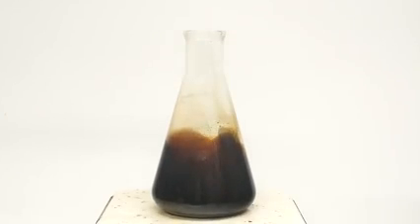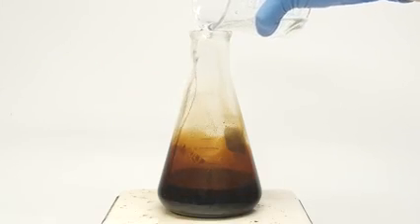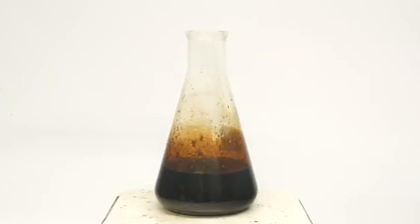To find out if I've actually made any triglycerides though, I'm gonna have to process it a little. The first thing to get rid of is the zinc chloride catalyst. Zinc chloride is very soluble in water, so it should be pretty easy to wash out. It's important to remember that this reaction is reversible, so when water is added, we could start to get some ester hydrolysis. At room temperature and with such dilute conditions, this shouldn't really be a problem, but it's still best to go as fast as possible.